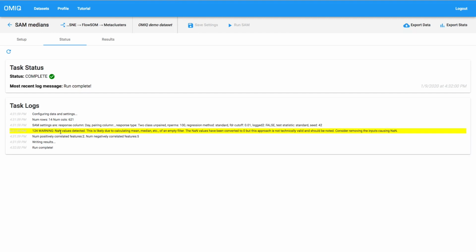And when we're running with medians on a bunch of different clusters or filters of our choice, what can happen is that we're trying to take the median of an empty cluster. And so what happens when you do that, because that condition is not defined, is you get NaN in the data. And what we do in that case, just to make it so you can still try to get some signal out of it, is we convert NaNs to 0. But this is technically not valid. It might work for your purposes, but you should just consider it.